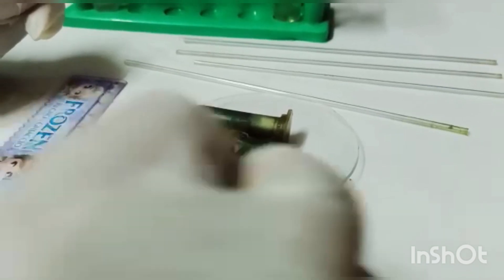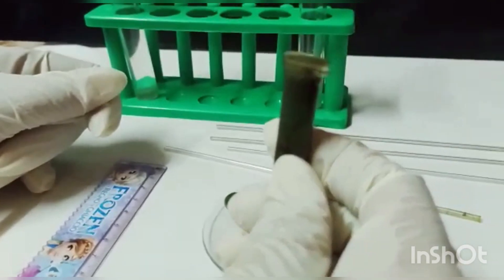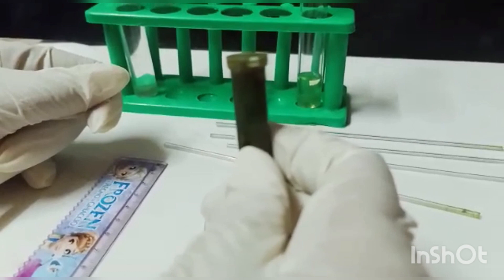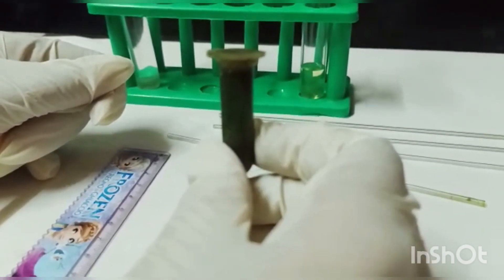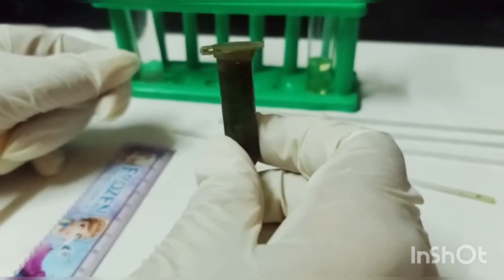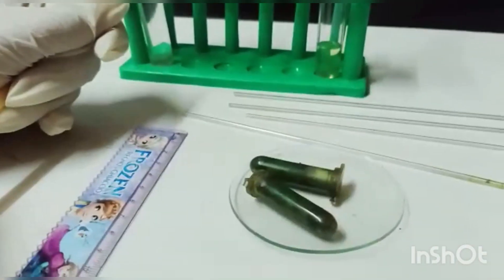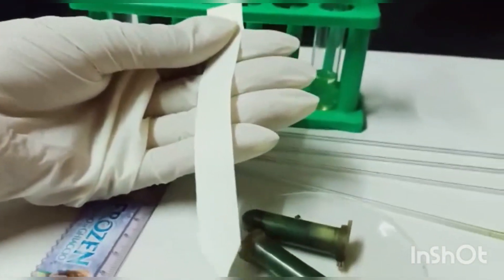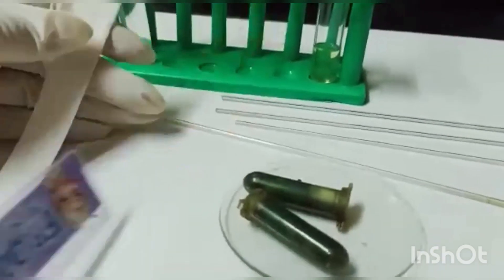Let's start the practical. As I have told you, we have to make the extract. This is the extract of spinach leaf — we use acetone and grind the leaves in a pestle and mortar. You can store this extract in eppendorf bottles to reserve it for a long time. Now, here is the chromatography strip — this is a blotting paper strip — and you have to mark the strip approximately two centimeters from the bottom.